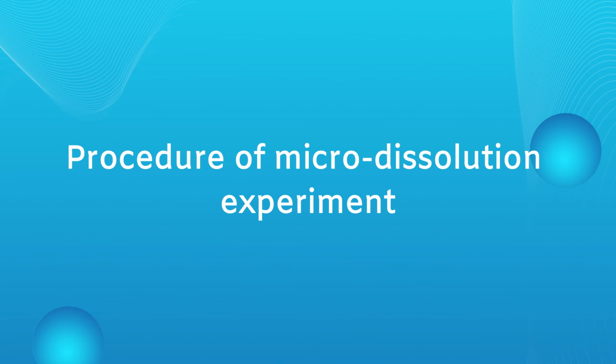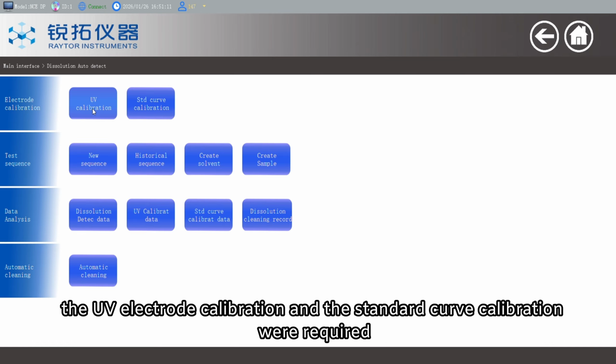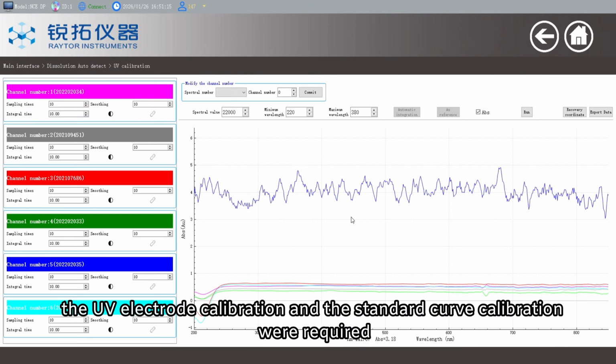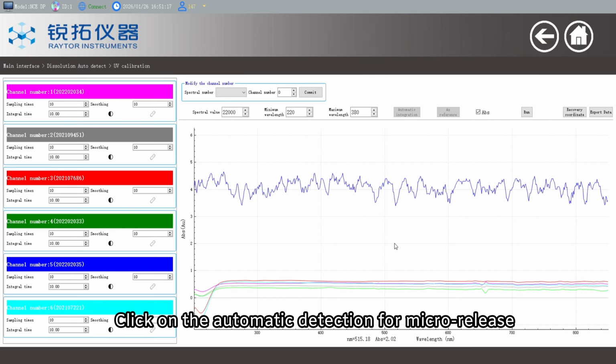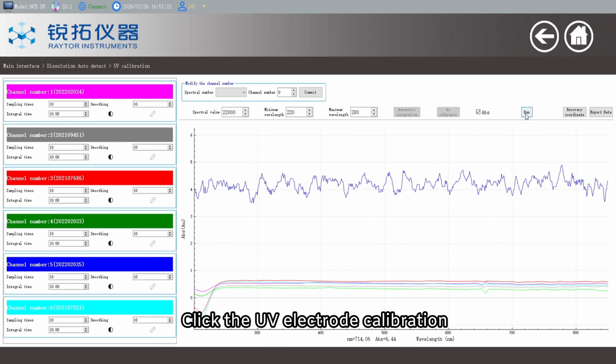Procedure of micro-dissolution experiment. Before the formal experiment, the UV electrode calibration and the standard curve calibration were required. Click on the automatic detection for micro-release. Click the UV electrode calibration.